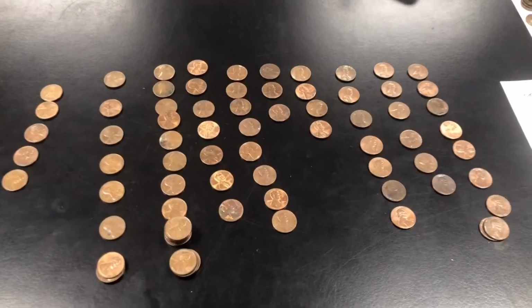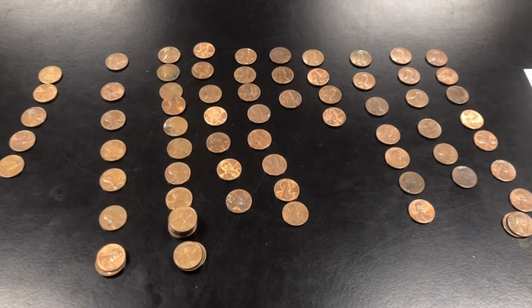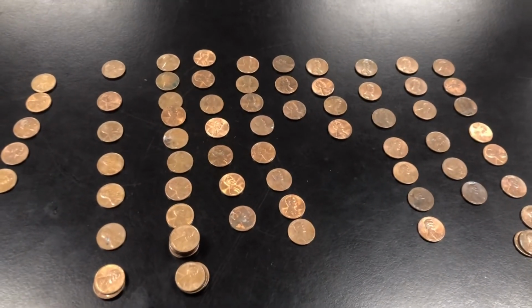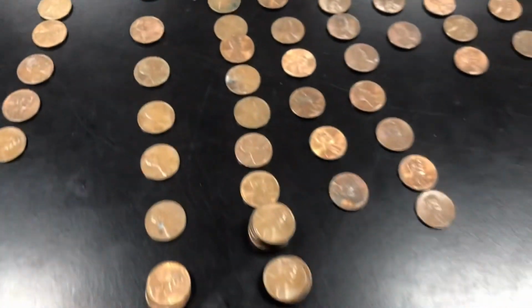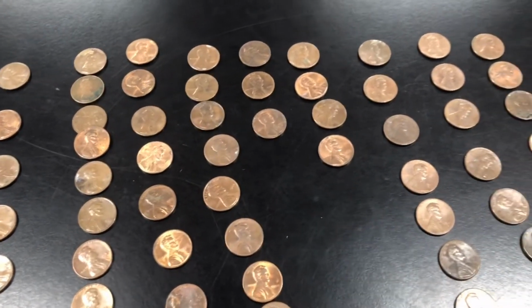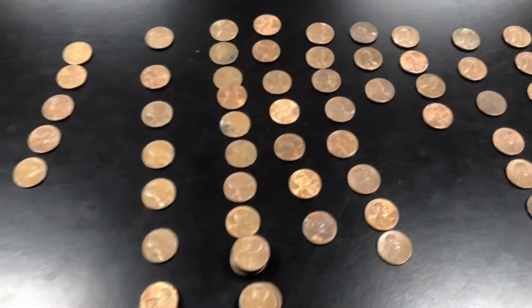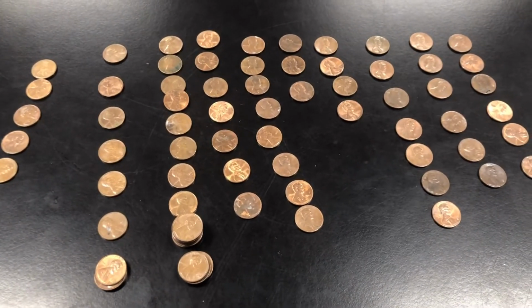You decide. Okay, so we know that somewhere in the 1980s, our density changed. Either you looked it up or our data came out that way. So to be able to prove this, whether we looked it up or not, we're going to get the density of the 1980, 81, 82, 83, 84, 85, 86, 87, 88, and 89 sets of pennies that we have here. It might be a little tough because we only have a few pennies. So that may be a problem for accuracy and precision. So let's take a look at these so we can get our data.